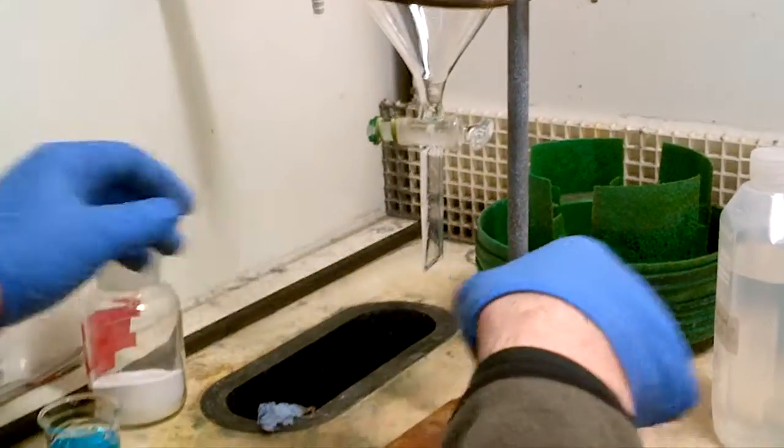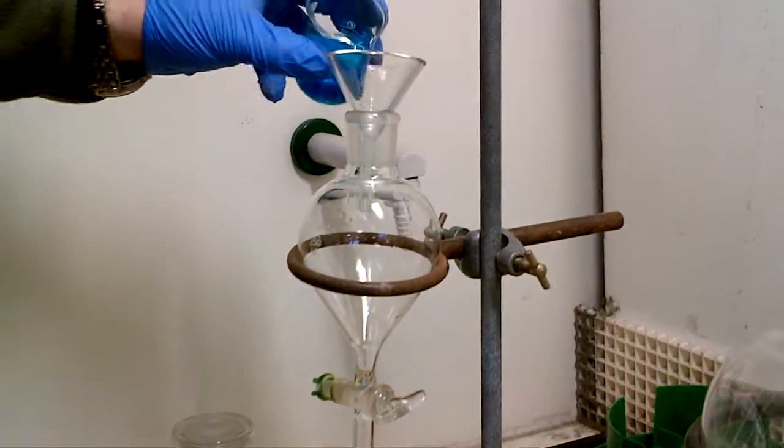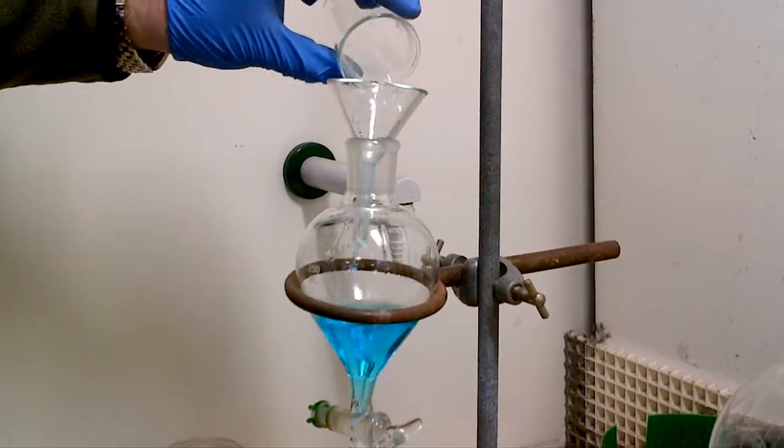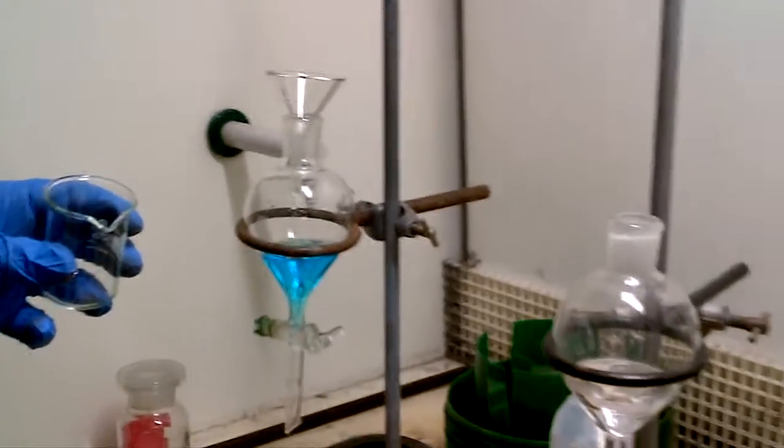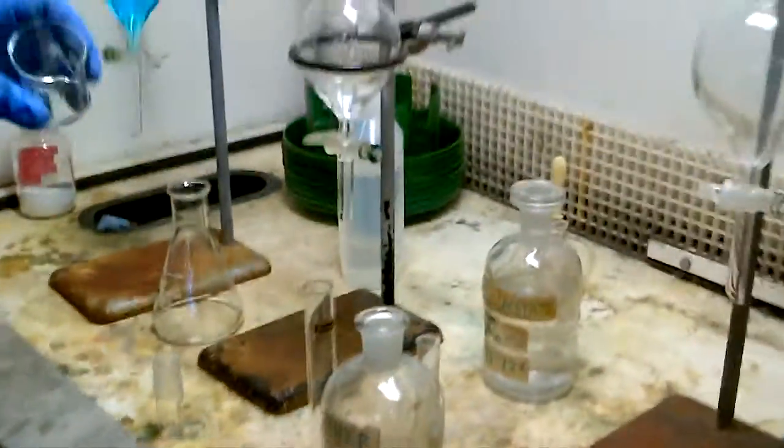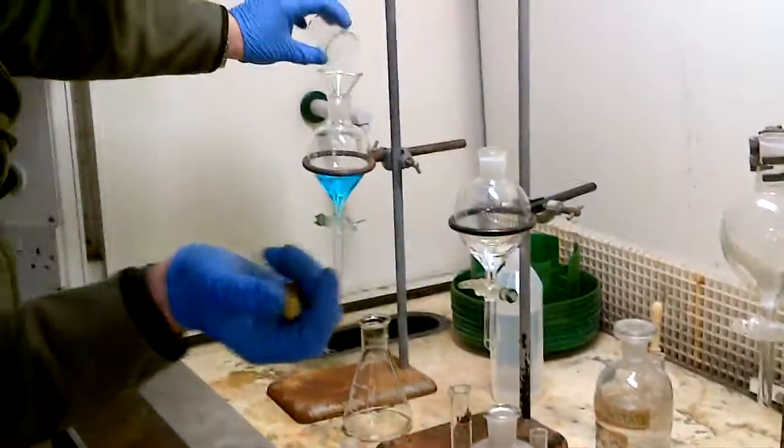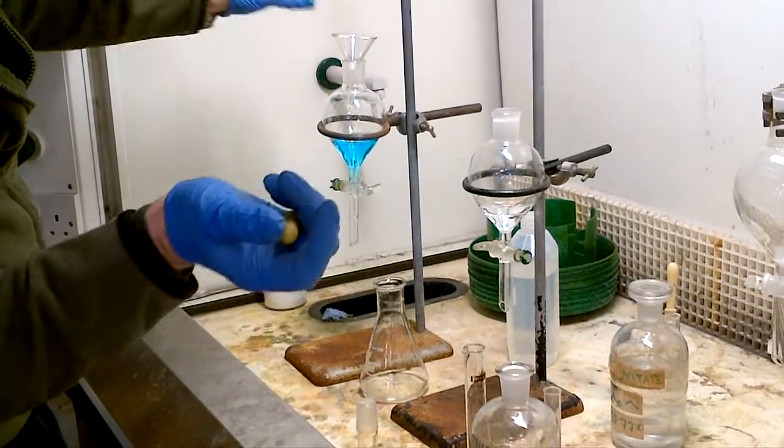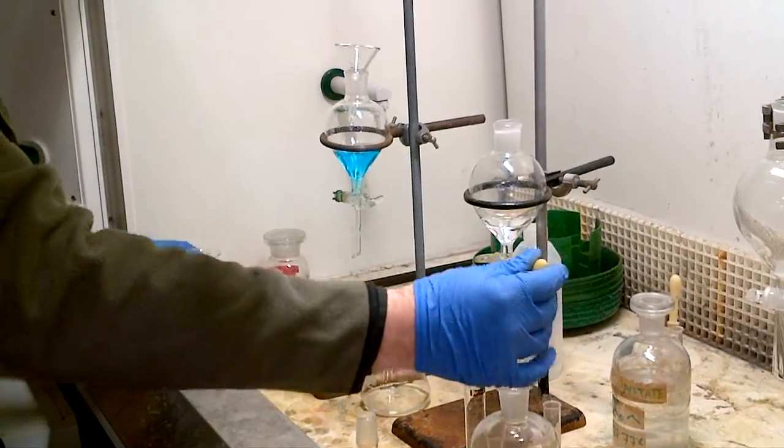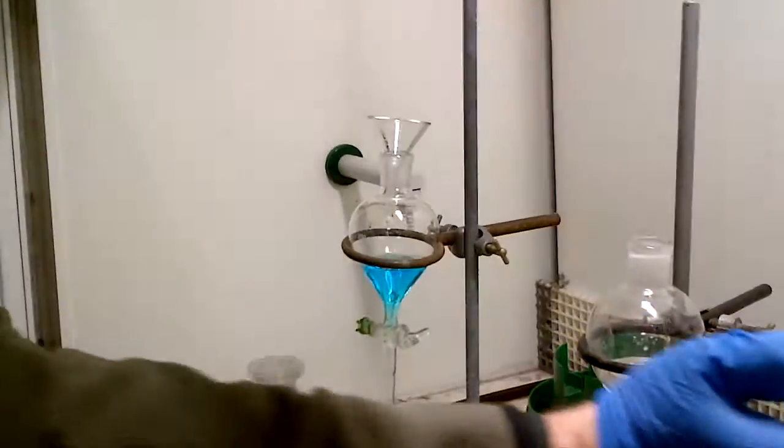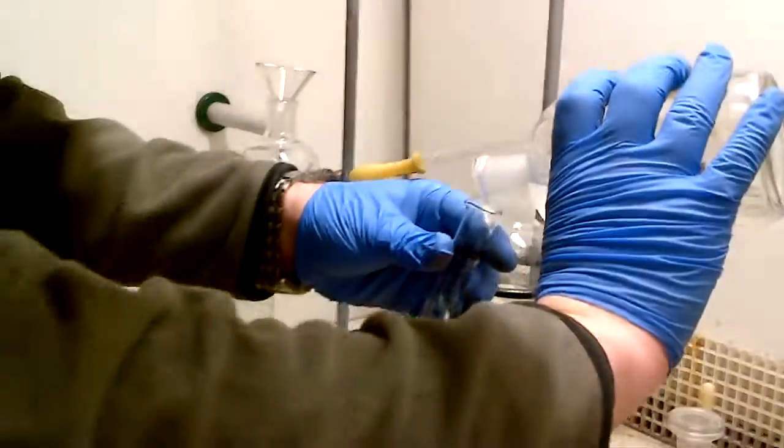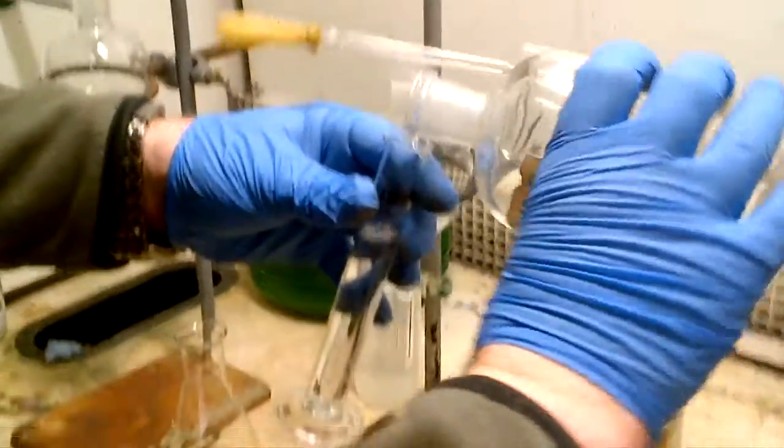So we've put all the organic into place here, let's just quickly again put this back into the funnel, put it back into place, put it back in, so we'll extract with our second lot of 25ml, so again, it'd be rude not to rinse the inside of the flask, put some ether, one, two pipettes worth, put it in, quick, rinse the funnel. Oh sorry, the inside of the filter funnel, next lot at 25ml, throw it in.